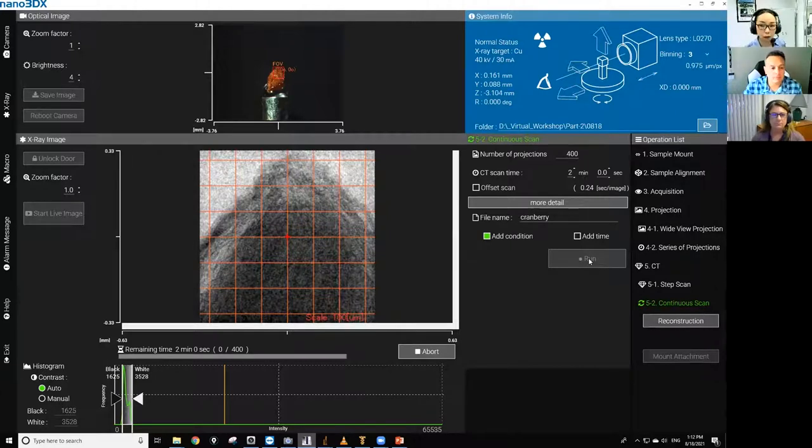It's probably a good time to answer some questions if there are any. Yeah, so we did get a question and you kind of addressed it at the beginning. So Michelle asked, can you collect multiple scans of different sections of this cranberry and then merge them to create a single scan of the entire object? Yes, you can. So in this particular setting, if you're going to do that, there are sections of the seed that's wider than the field of view.